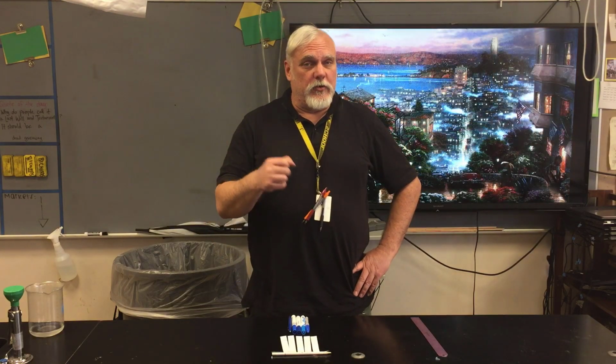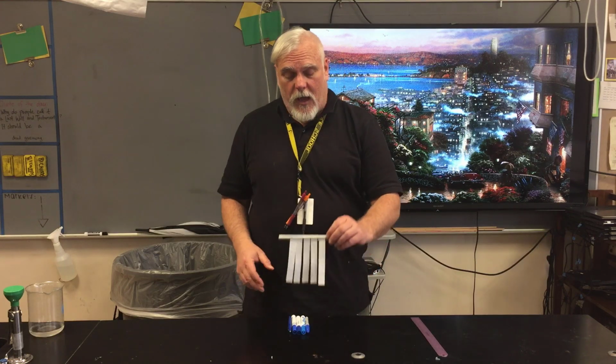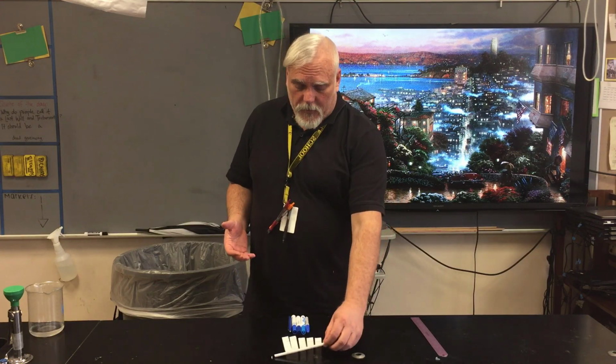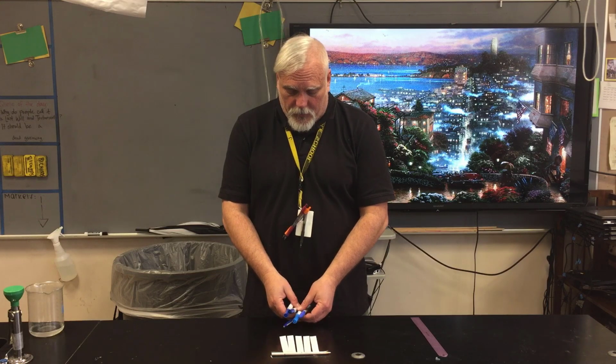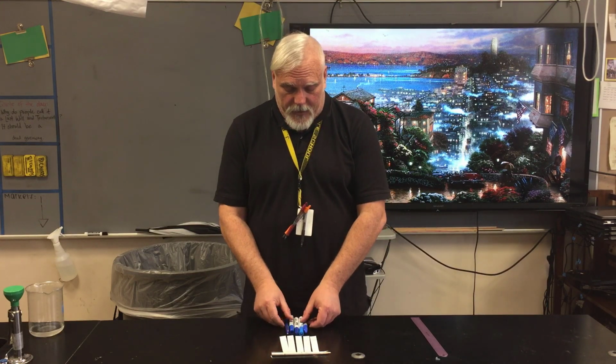Everybody, welcome back to Mr. Richard's Journal. Today we're going to take a look at paper chromatography. What I have here is 5 strips of paper that we're going to use, and I have 5 different colored blue markers. So let's take a look at how we're going to do this and see the results.